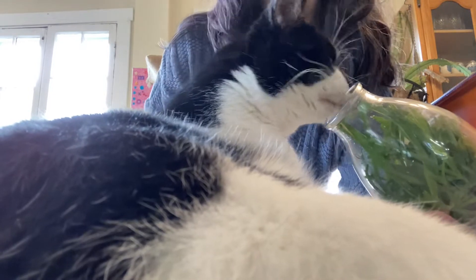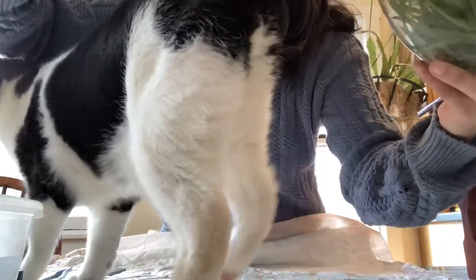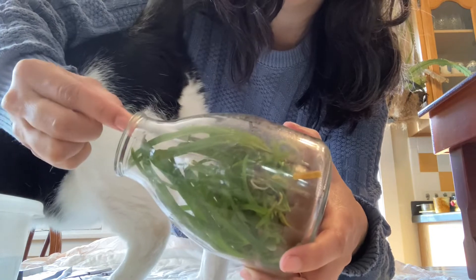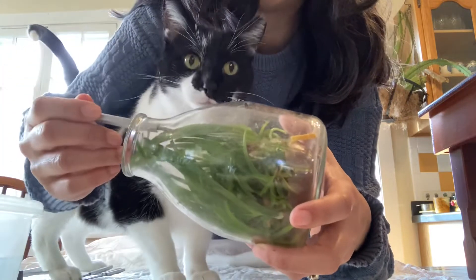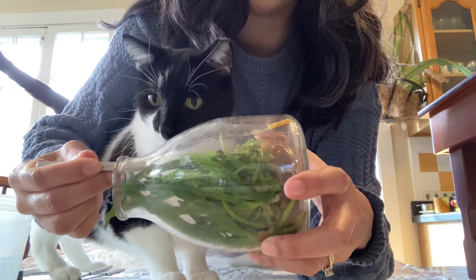Keep Pinto from knocking the camera. The idea here is to get the hook in here and then use it to pull the agar out toward you. I don't know how well this is going to work. The agar is just breaking up.